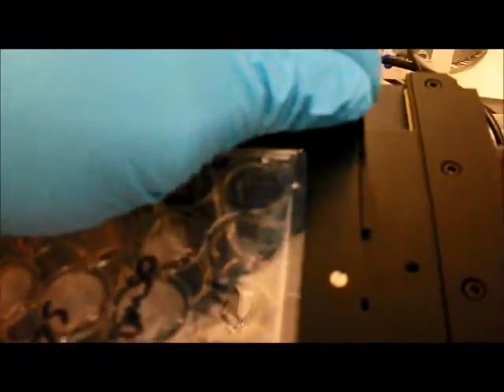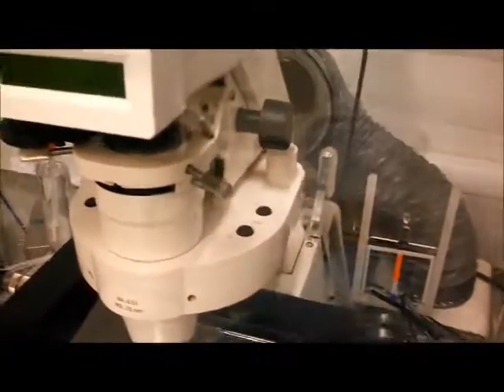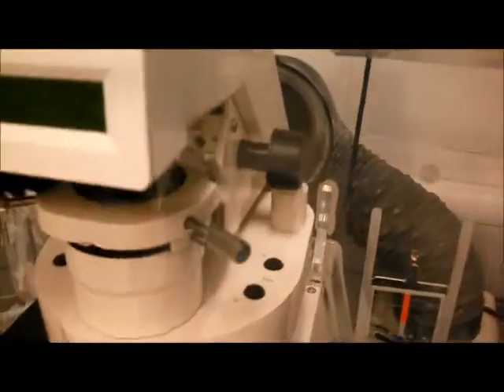Put the clip, the screw into place. So just make sure that's all sturdy, and then close the doors. It's good to have the condenser up to its maximum height, which you can adjust on there, so just have that up to its maximum. That prevents images going light at the end of the run. So just shut the doors.